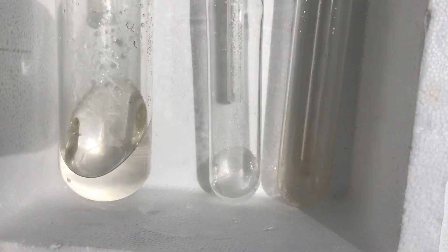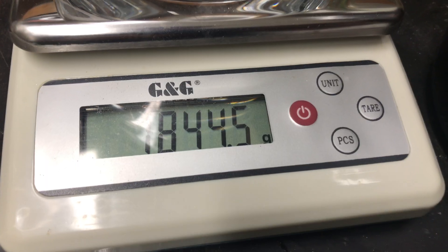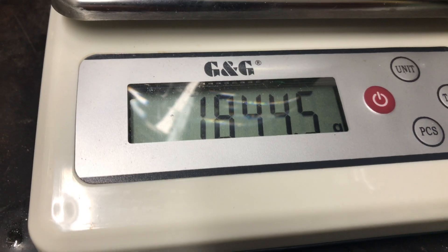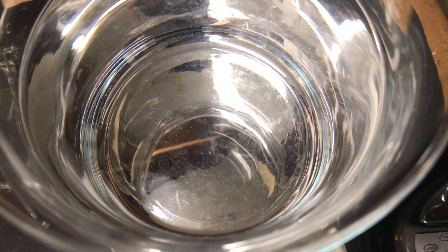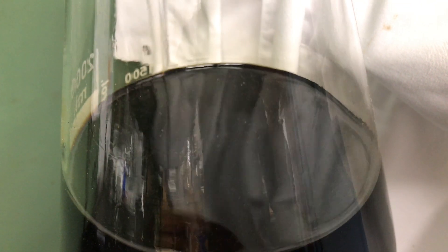In the end more benzene was collected in the cold trap and this was combined with the other benzene waste. We were left with about 1.8 kg of product and this corresponds to a 62% yield. The yield is relatively low and this is the reason why I'm keeping this black liquid. In the future I'm going to isolate impure product from this.